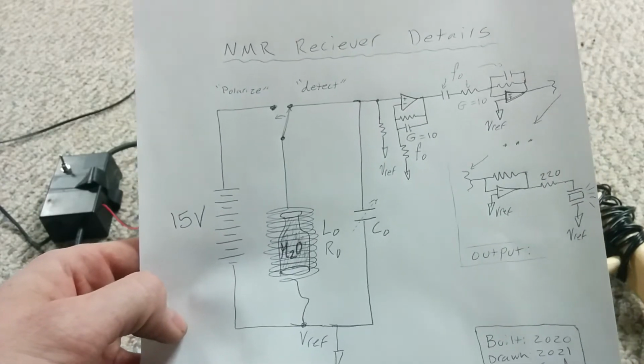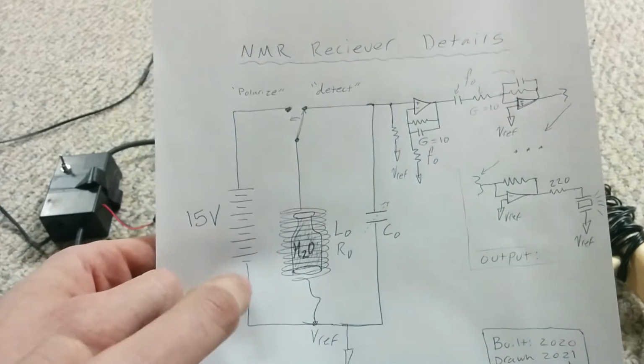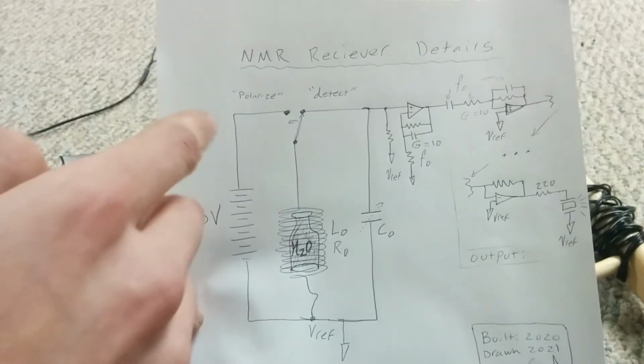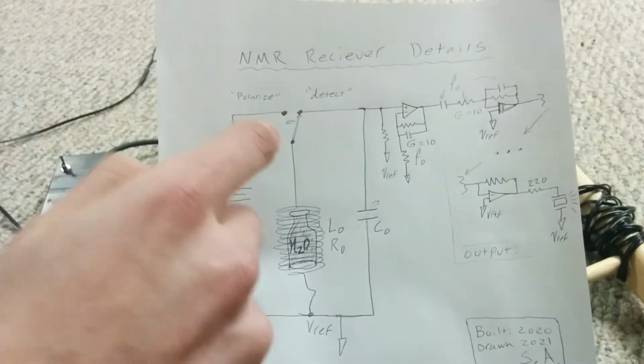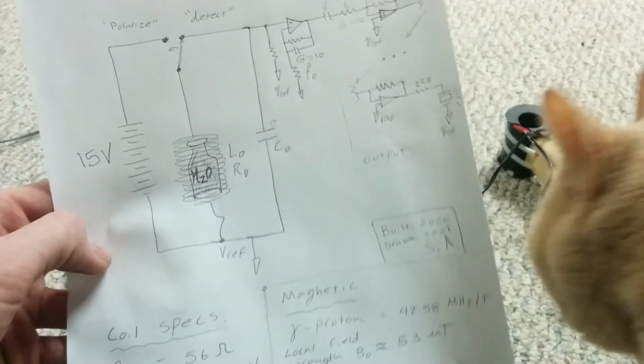So the basic idea is that I've got a coil that I need to pump a bunch of current through using a big, powerful battery, and let that happen for a few seconds, and then flip over a switch to close that coil across an amplifier.